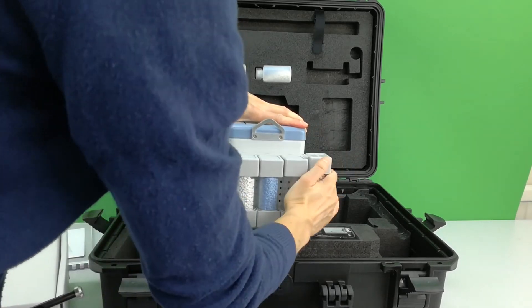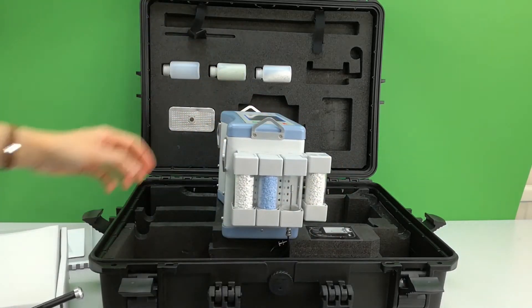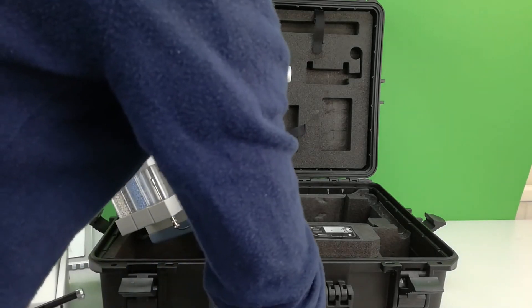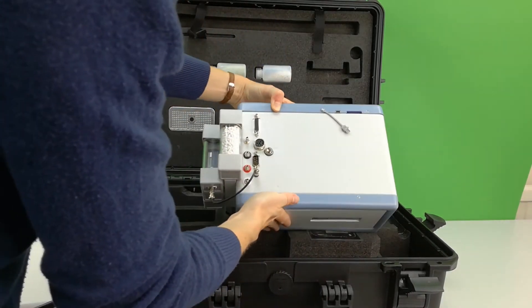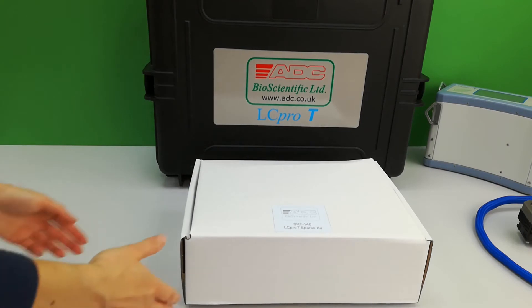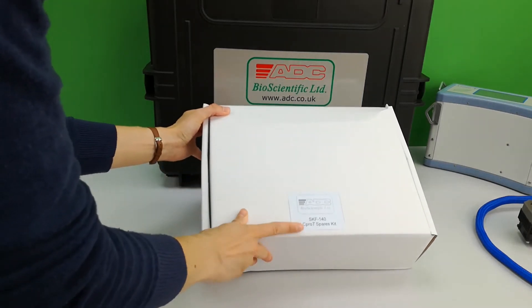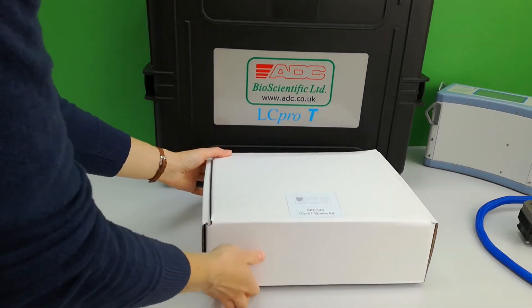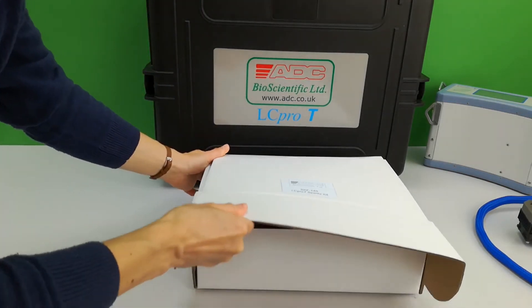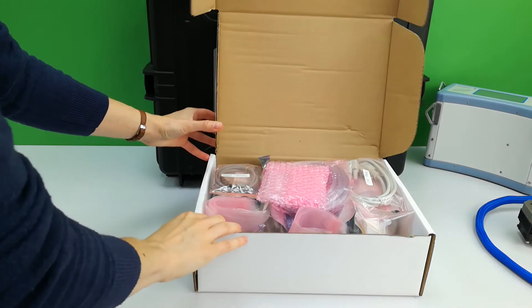On this model, an integral temperature sensor is provided — this may not be supplied with newer systems. A complete kit of spare parts and consumables is supplied with every new system, containing everything required to maintain and utilise the system long term.